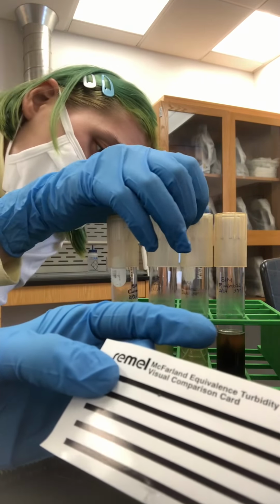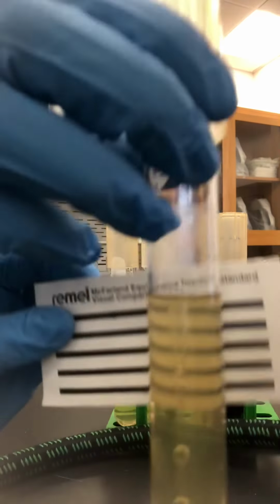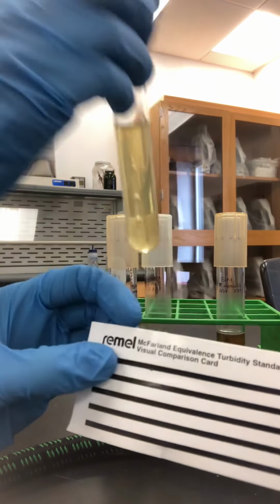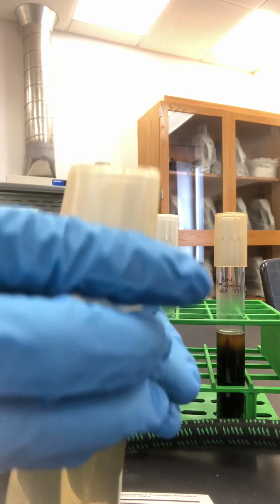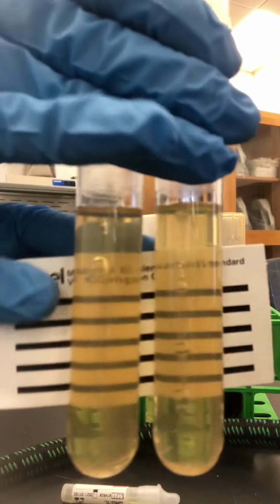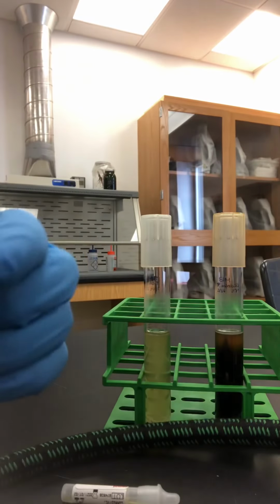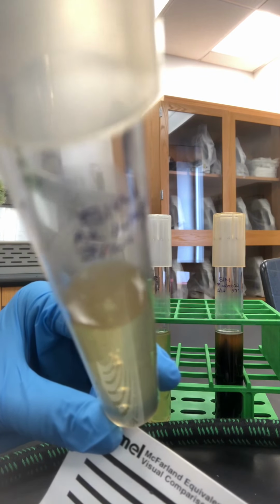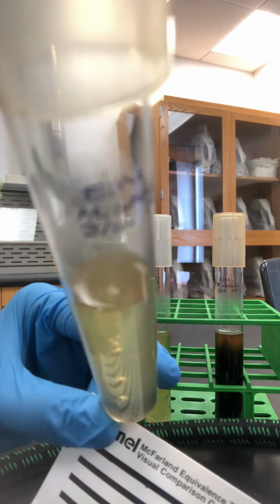Our next organism is Micrococcus luteus, M. luteus. So we can look at that. Again, super hard to tell, so we'll compare it to something else. Let's compare this M. luteus to the control. Looks pretty similar. Let's make sure that there's growth. Yeah, so M. luteus should be yellow. You can see a yellow dot where my stab entered the agar.